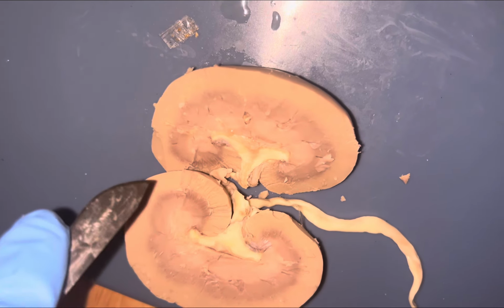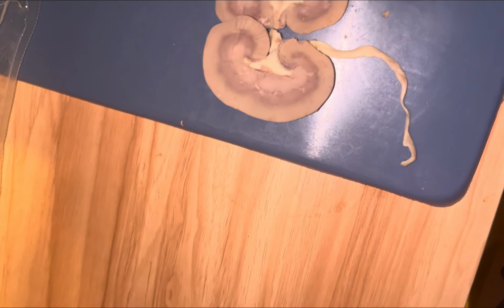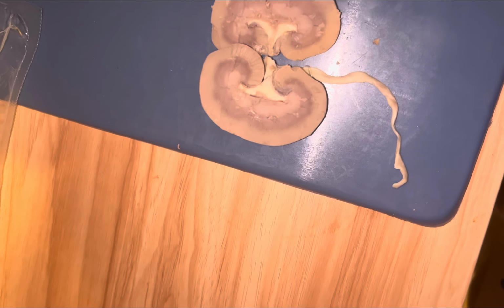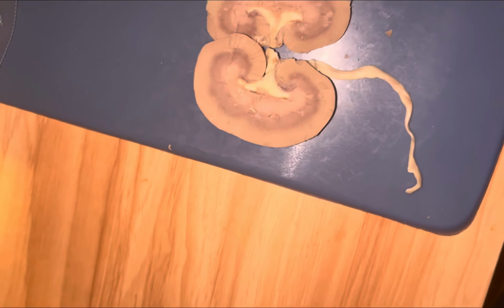And then you have the renal papilla, which is the tip or the point of a renal pyramid where the urine drains out into a minor calyx, which is the tip right there. And then you have the renal pelvis, which is the big funnel-like space in the kidney that collects all the urine from the major calyces before it heads into the ureter. And that is going to be down here, right under that cup-shaped calyx.